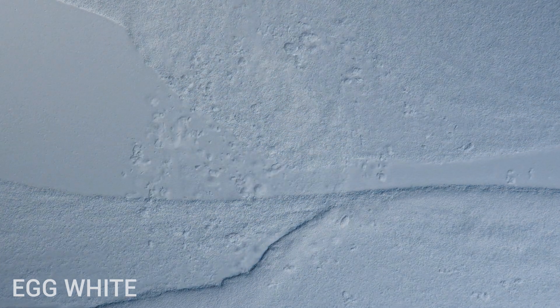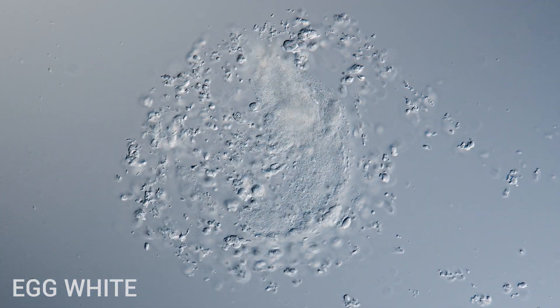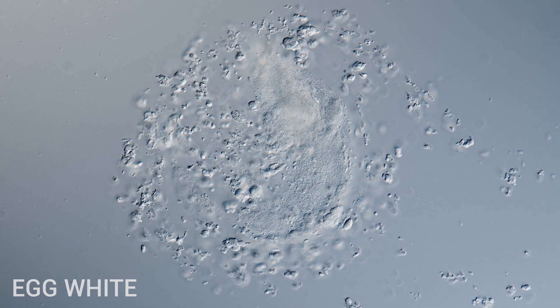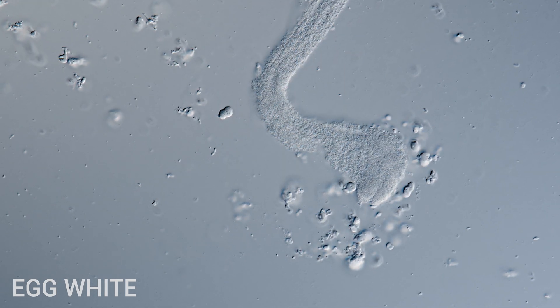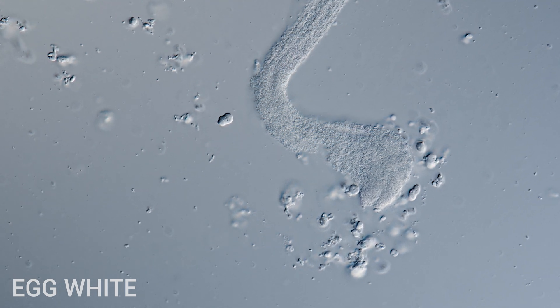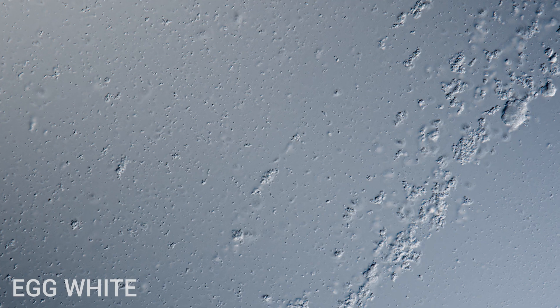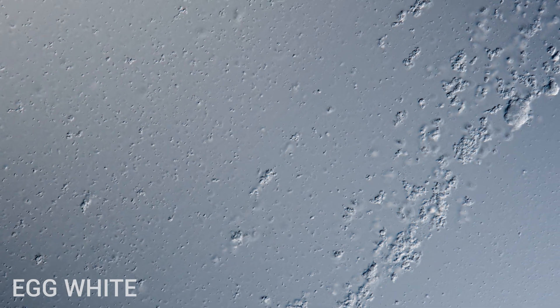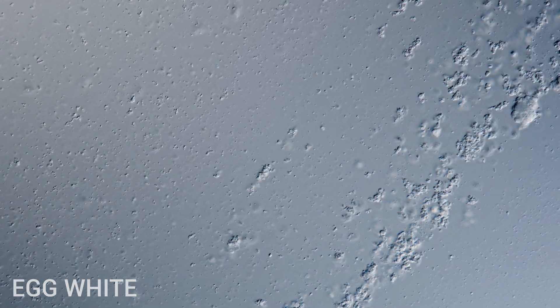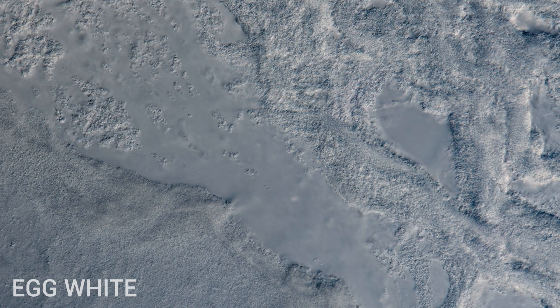When heat is applied, those proteins uncoil and get tangled together. When they tangle, they create particles big enough to see. The primary natural purpose of egg white is to protect the yolk and provide extra nutrition for the growth of the embryo.